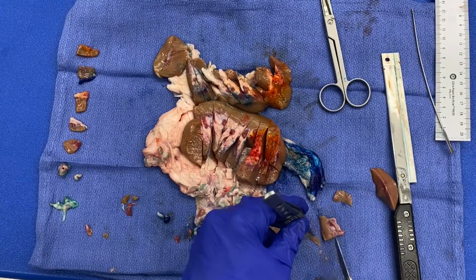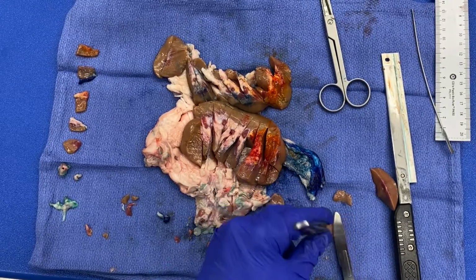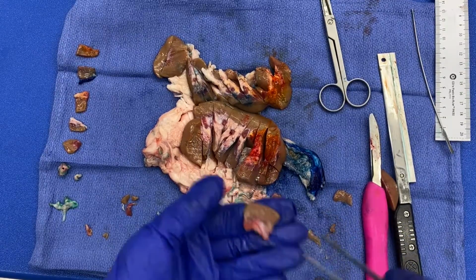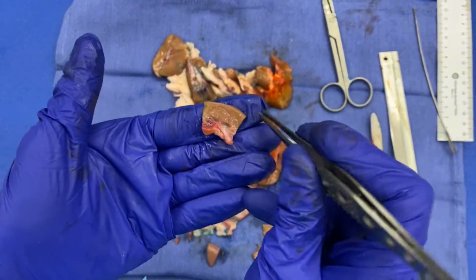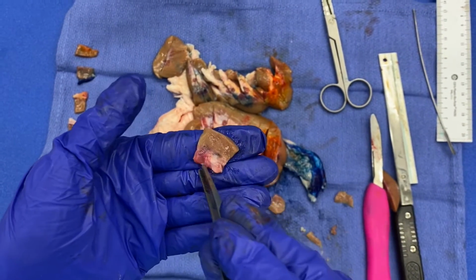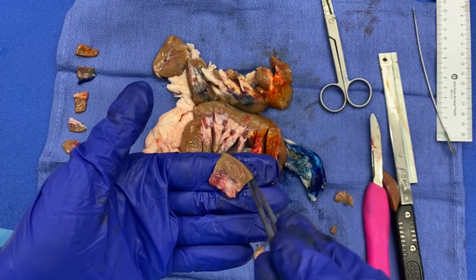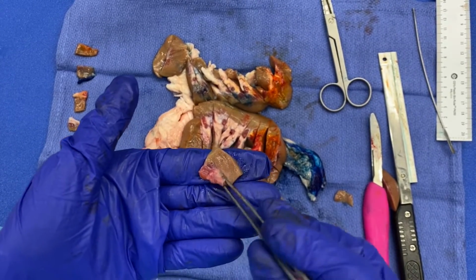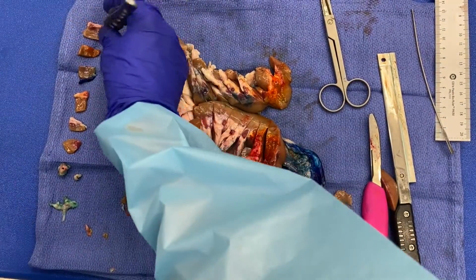It ensures that there's not marks left on the tissue from the cassette being closed on it and being too thick. And you also, size-wise, don't want to make it too big because you want to ensure that there's an adequate rim of paraffin that's able to be infiltrated and put into the mold so that the tissue can then be cut well on the microtome. So then that would go in the cassette.